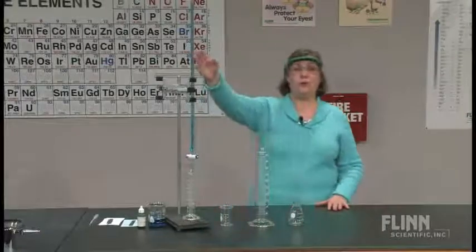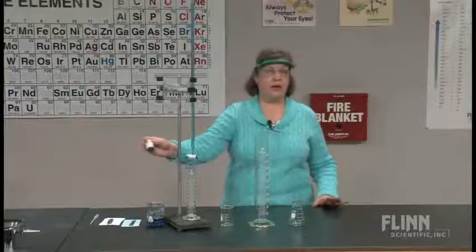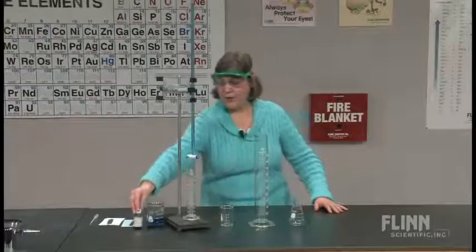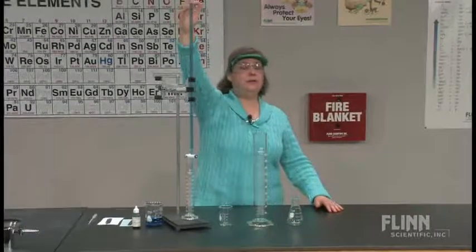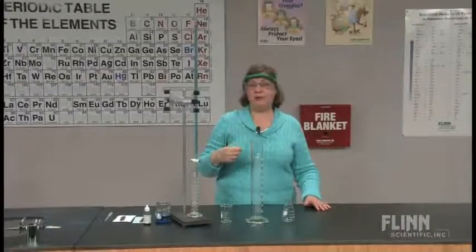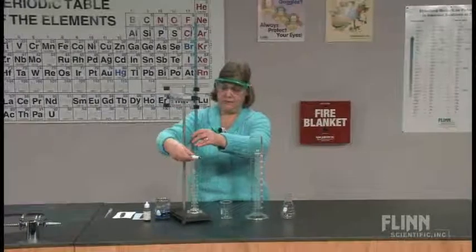We're going to start with the burette, and I've simply filled it with some colored water. I simply took some blue food coloring and added that to water, just so that we would get a little color in this and it wouldn't just be colorless water in there. So I filled that, and I've already zeroed it on the top so that the upper level of the water there is exactly at 0, okay? And what I want to do is deliver 50 milliliters of water from the burette into the 100 milliliter graduated cylinder. So I'm going to go ahead and do that here.